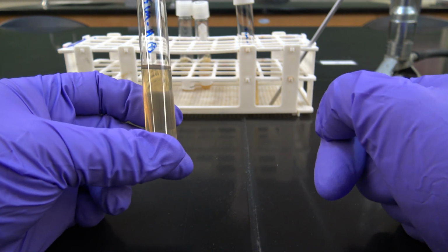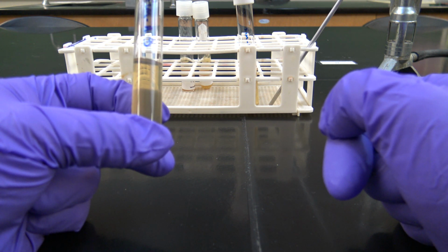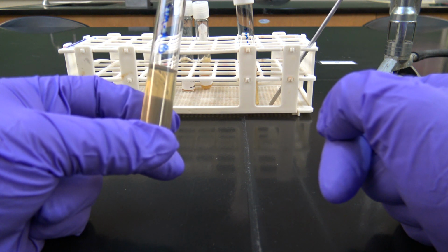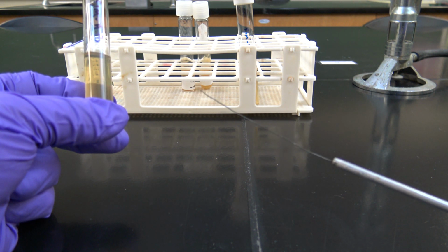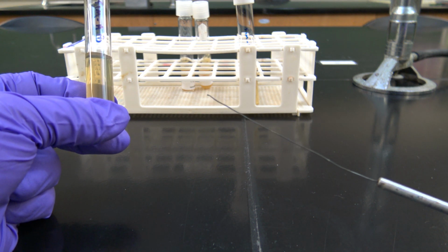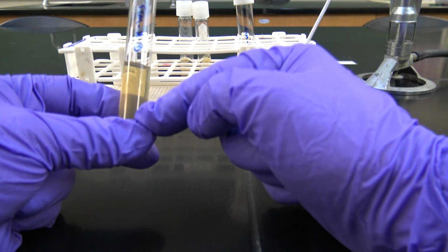So we want to do a SIM test on both our gram-positive and gram-negative microbe. And this test's a little different because it's not using an inoculating loop, but rather an inoculating straight loop or a stab like this. You can see that there's no loop on the end of this. It's just a straight needle-looking device. That's what we're going to use to pick up our cells and then inoculate the media with.